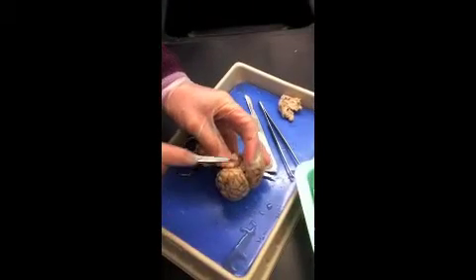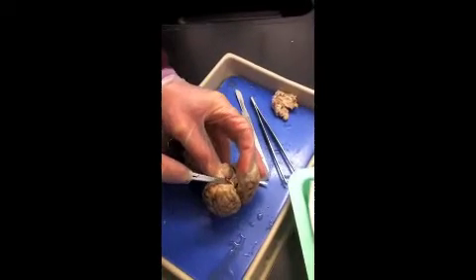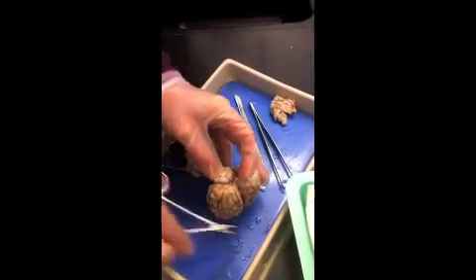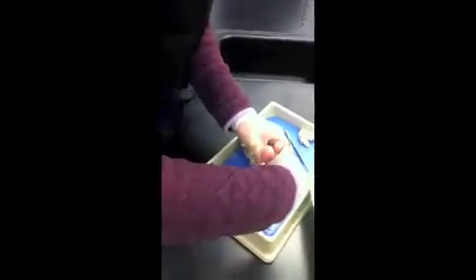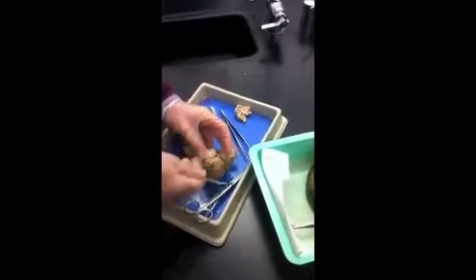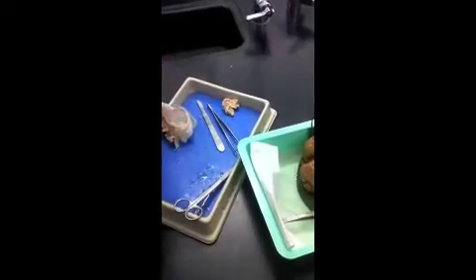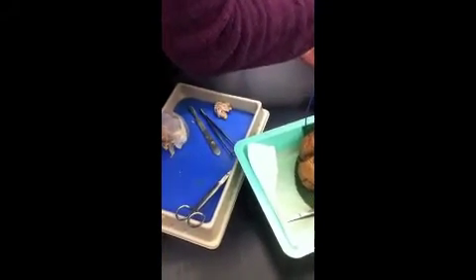Just ahead of the superior colliculi, you see this little mass projecting right there. It's got some attachments around it. Kind of like a little nose poking up. You see? I don't know if you can all. I'm really ripping up this guy. Can y'all see that little bump projecting right there above the superior colliculi? So there's a little bump right there, just in front of the superior colliculi.